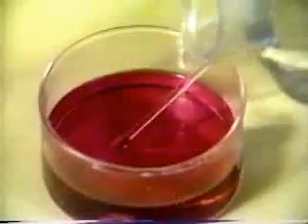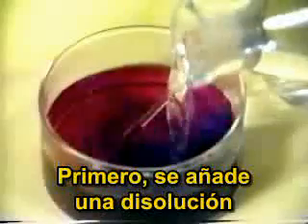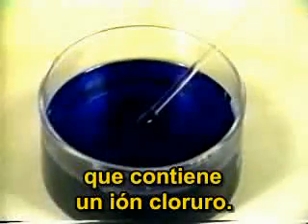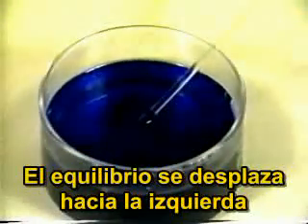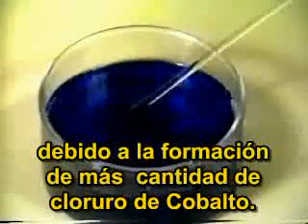First, a solution containing chloride ion is added. The equilibrium shifts to the left, and the solution turns blue due to the formation of more chloro-complex.